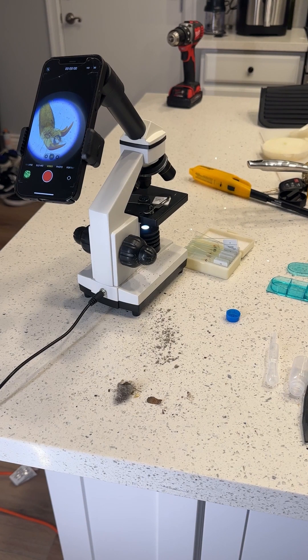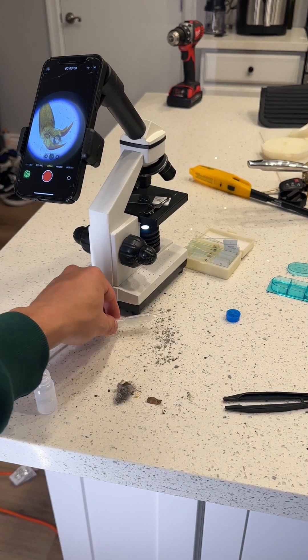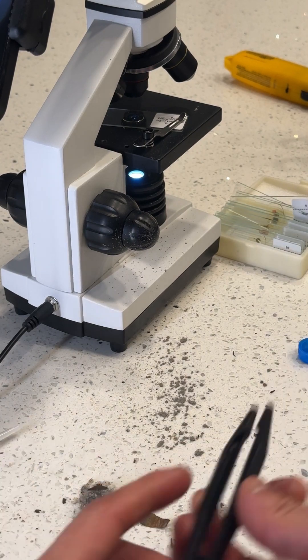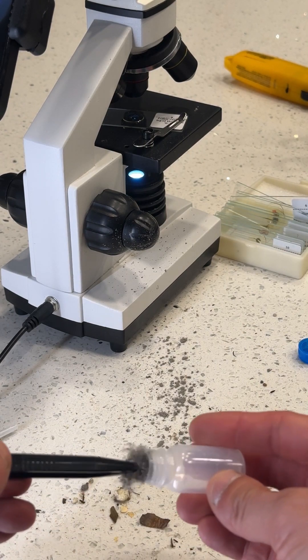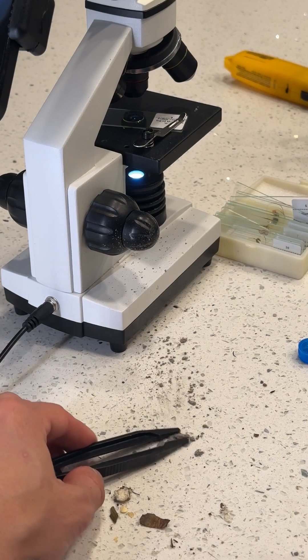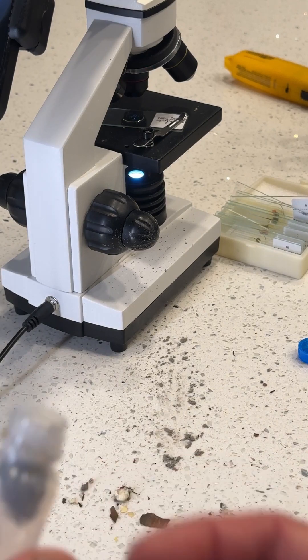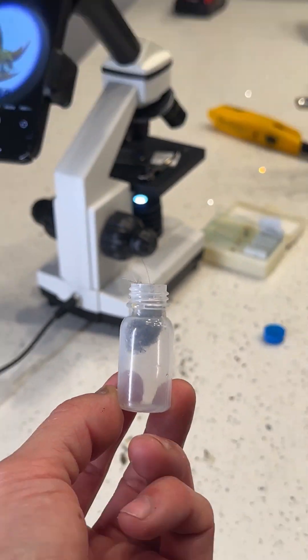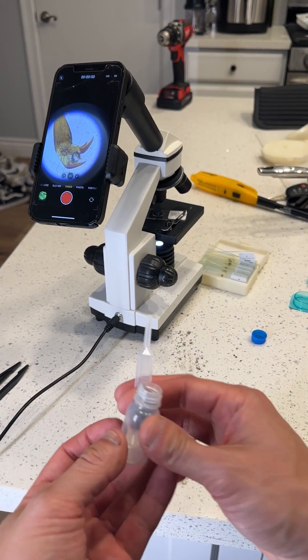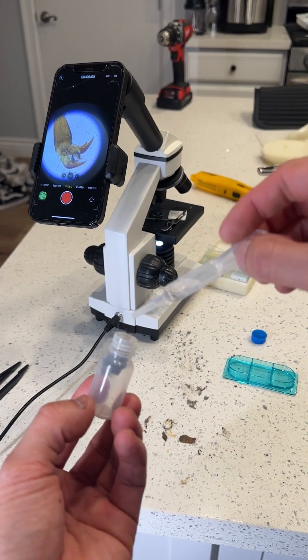Okay guys, today we're going to extract some of this dust on the table. This came from the vacuum, and the best way to do this is to stick that in there. That's nasty stuff in the vacuum. We'll just try and see what's inside. We're going to inspect what is really in the dust — is there really dust bunnies in there? Is there really living things, even though supposedly all of us are super clean?